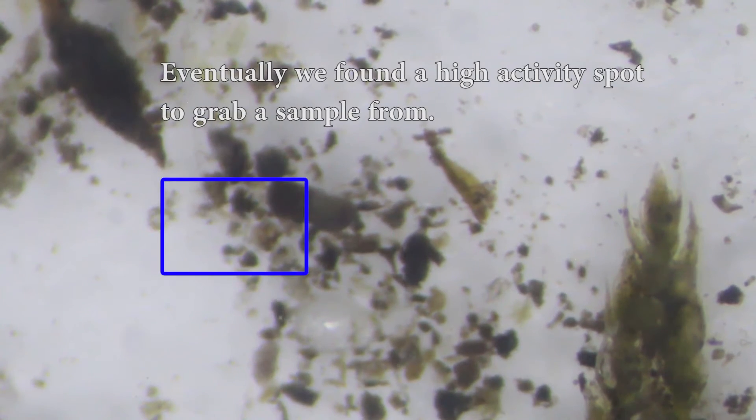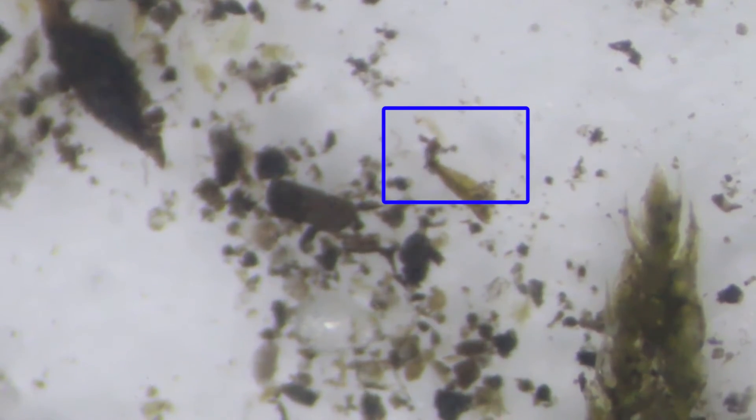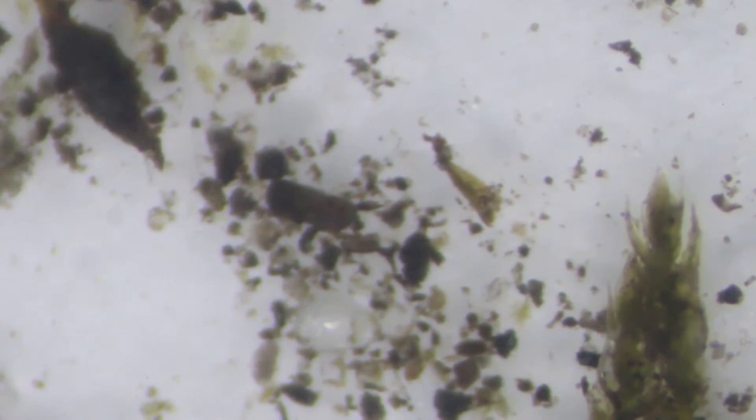Oh look, there's something there. Is it a white thing or a blue thing? See, there, there — left middle side. Go get me the eyedropper. Don't touch it, it's a touch screen. Oh, there's one right there too. Go get the eyedropper from the top drawer. We need to try and catch these guys.